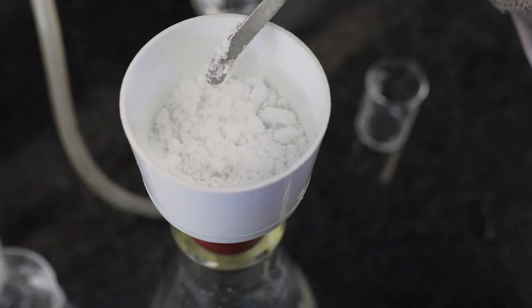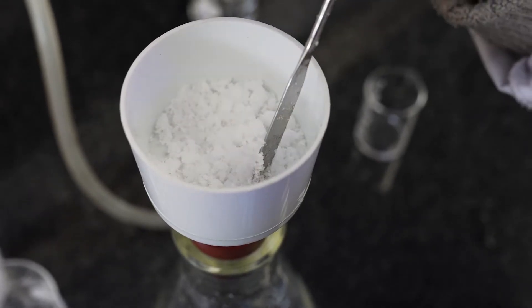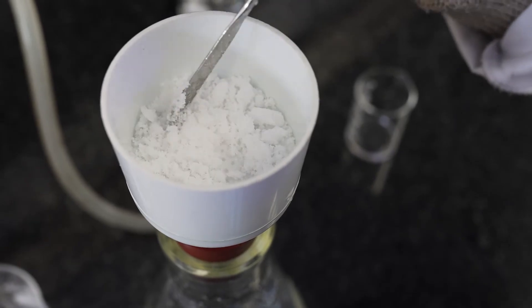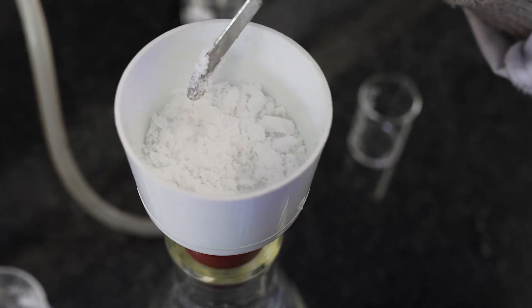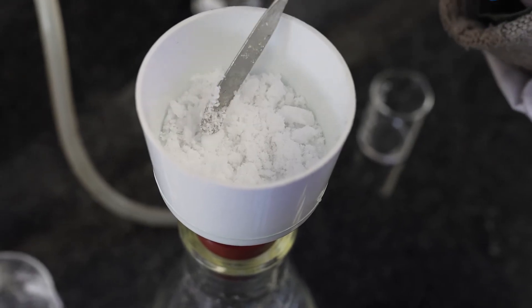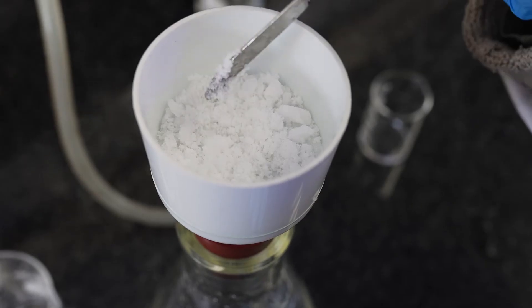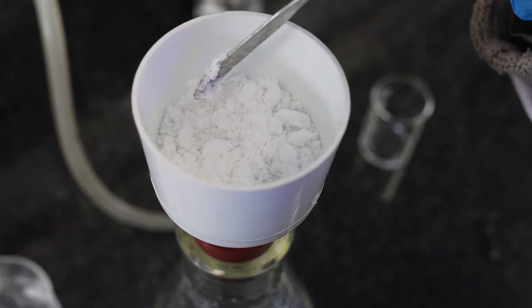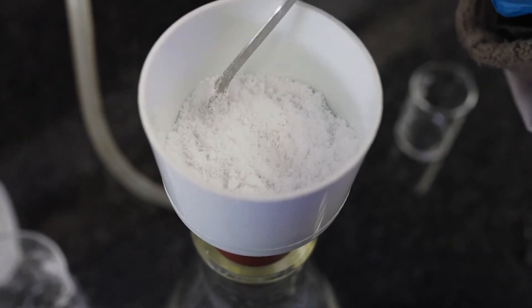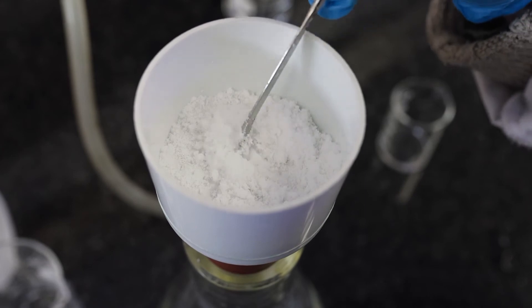With the Buchner funnel it's important to use it when we want our crystals to be dried of any water. As you can see, if I move the crystals around at the moment they clump together — this shows that they're still wet, so we're going to have to wait until these crystals stop clumping together, and then we know that all of the water has been removed. Now you can see that the crystals move around more freely, which shows that they are dry and don't clump together anymore.